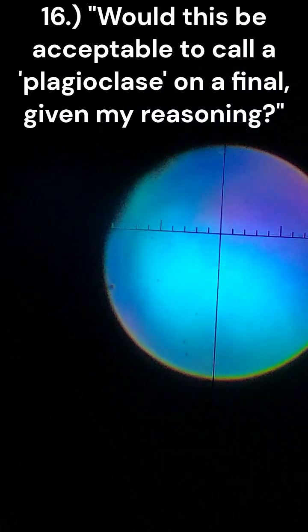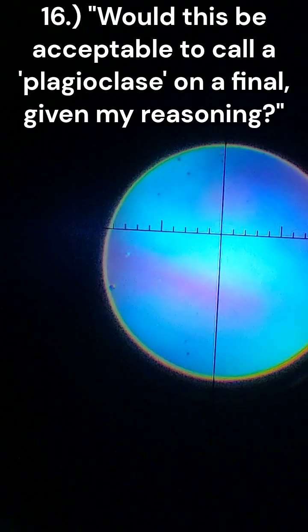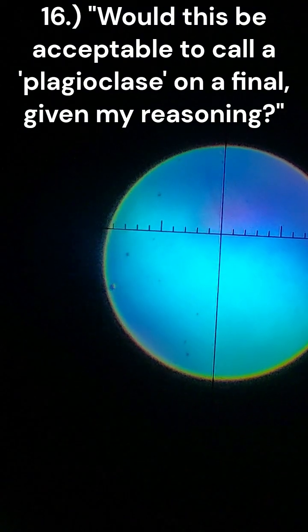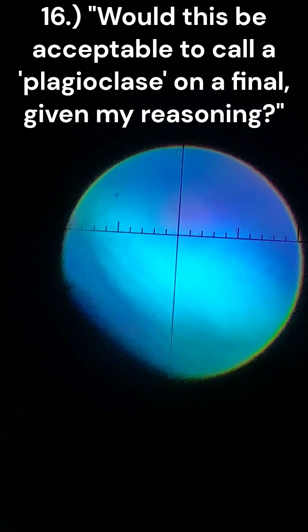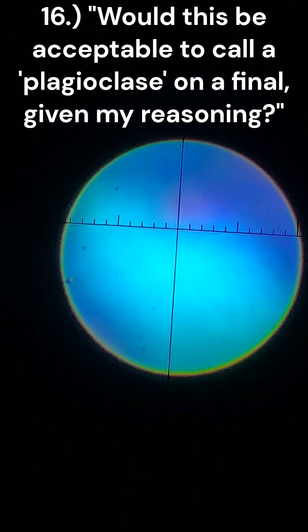Blue being in the center, red being on the outside, makes me believe that this would be a negative biaxial mineral. Not really sure what albite has, but I'd like to know if my interpretation of that was at all insane.